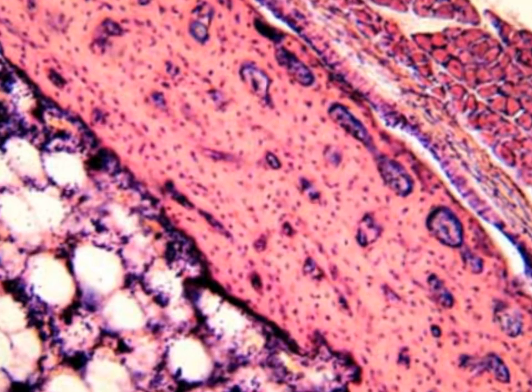If you have a label for these small dots here, these are the osteocytes in lacunae. So in this area, we don't have anything except these Haversian blood vessels. If you have a label for this transverse blood vessel, it is an anastomosing vessel between two Haversian blood vessels. After that, we have these dots that will be labeled as osteocytes in lacunae.